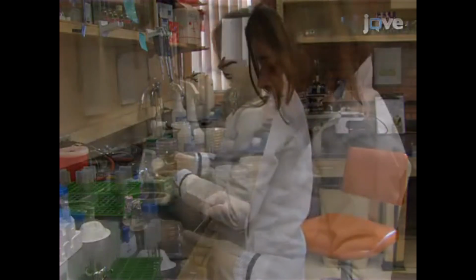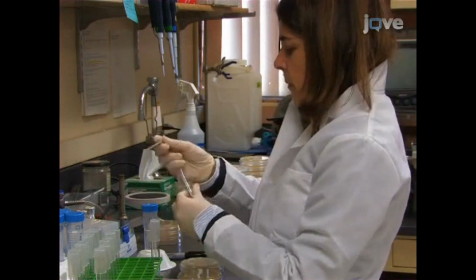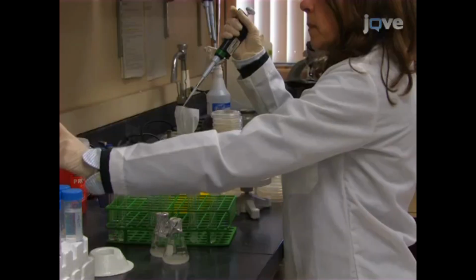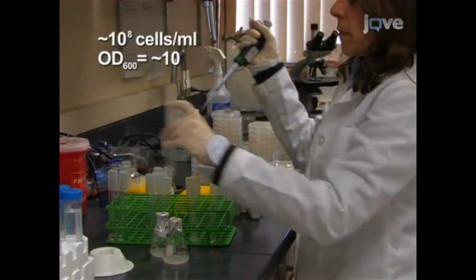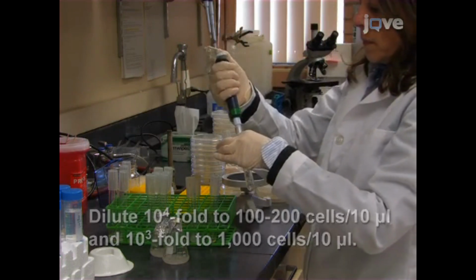Cell viability can also be studied in cells aged on plates. To begin this assay, inoculate a single colony into 1 milliliter of synthetic complete glucose medium and incubate overnight with shaking at 30 degrees Celsius. When the culture has grown to about 10 to the 8th cells per milliliter, dilute the culture with autoclaved water to 100 to 200 cells per 10 microliters and 1,000 cells per 10 microliters.